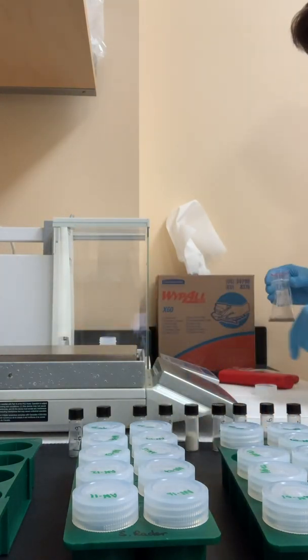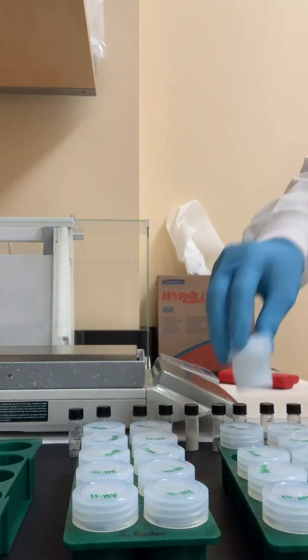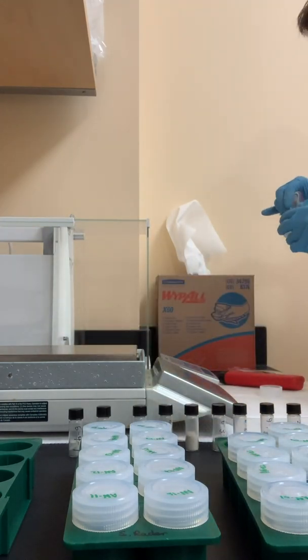Once the samples are weighed out, they're ready to go to the clean room. But before that, we have to get dressed up in something fancy. Because the metals I'm interested in are present in such low concentrations, we have to be really careful about contamination. Since I'm interested in metals, my lab has to be metal free — everything inside is wooden or plastic or some other type of material, but no metal anywhere. We also need to worry about contamination from things we may bring in ourselves — dust on the bottom of our shoes, particles on our clothes, and even our hair. This is why I get to wear a hairnet and these beautiful clean suits.